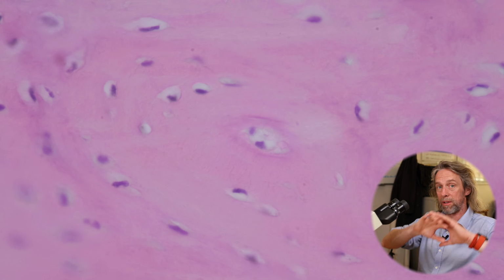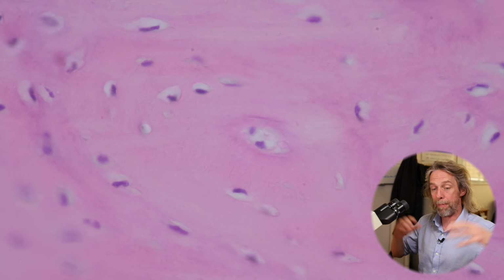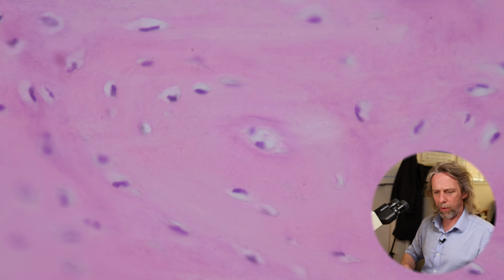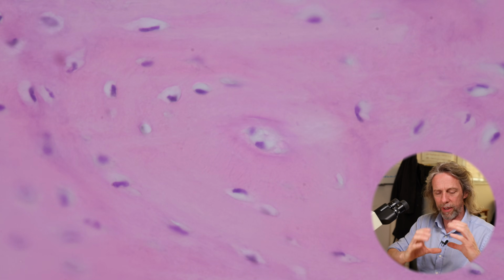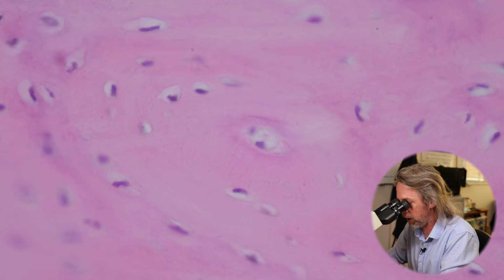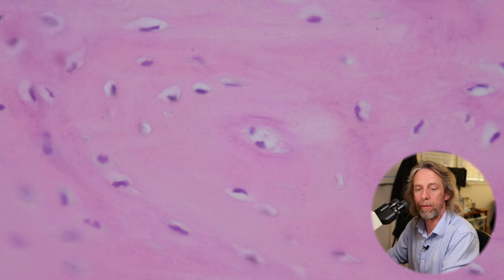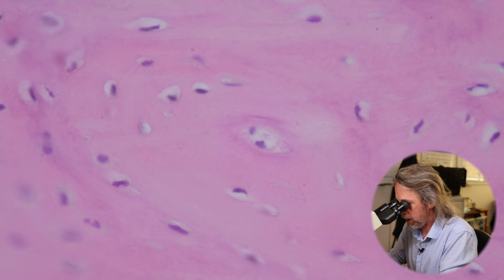These osteocytes have surrounded themselves with bone, they're maintaining this bone, and they're also within a lacuna. Now, you can just about get the sense of a circle there. So we're arranged into circles, and this is the Haversian system, this is the osteon. But with this staining, we can't see too much. We can see those cells are roughly arranged into that sort of a ring, but there's more to the story.